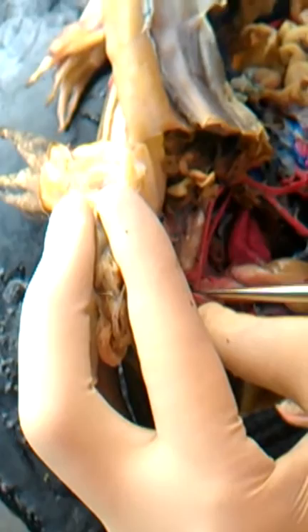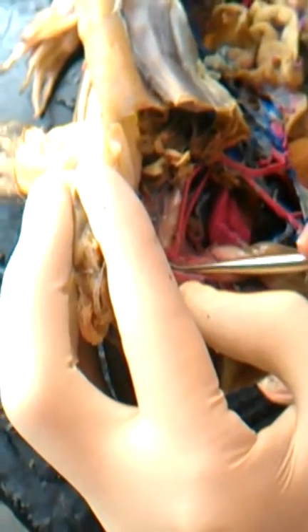This is one of the few frogs I've seen where you could see this. If you look down in there, what you see is 2 parallel blood vessels. The bottom one here I'm lifting up here is the subclavian. The anterior one toward the head, I'm lifting up, well, I can kind of get my probe underneath it, trying not to break it. Right in here is the occipital-vertebral. It's large in diameter, but it's short, and it goes straight down into the muscles of the back area, hence vertebral. Okay, any questions so far?